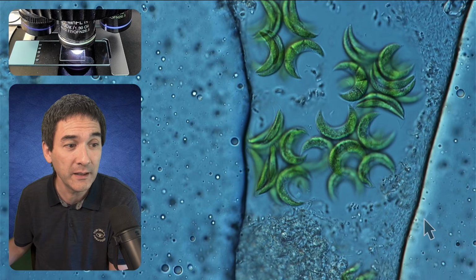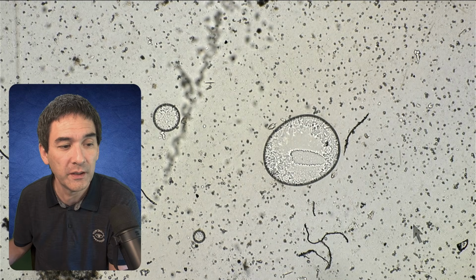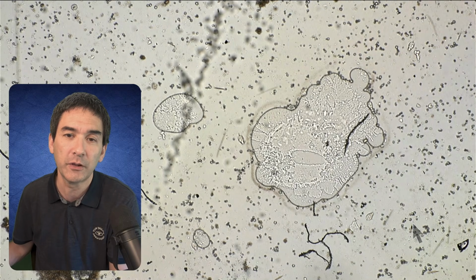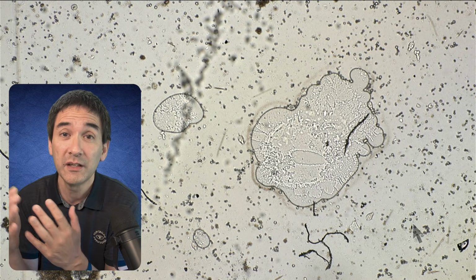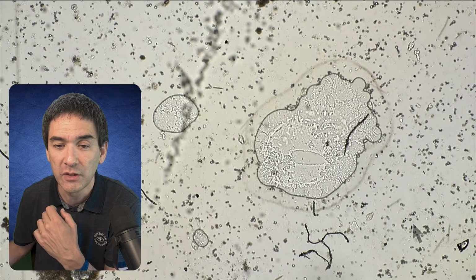As a matter of fact, over here, ultimately they will move completely to the air bubble. So you see over here, now it's actually touching it, right? Very close by. But why don't they do that right from the beginning? And the reason, and that's also what they found out, is that there is an optimum oxygen concentration. I would like to explain this to you here.